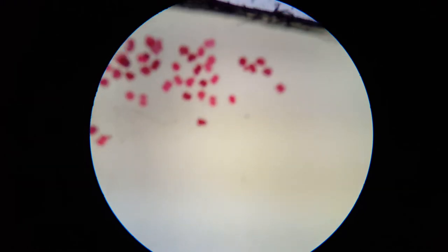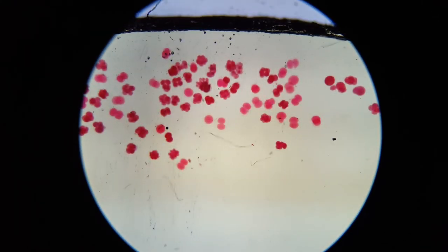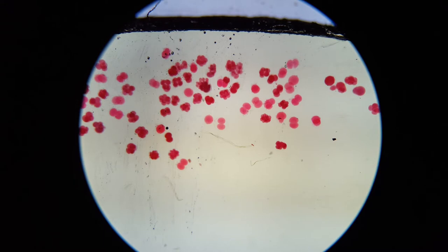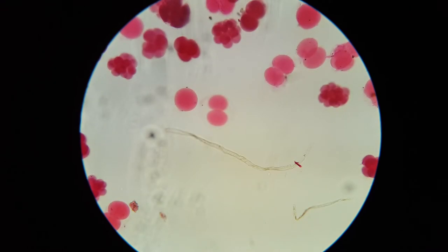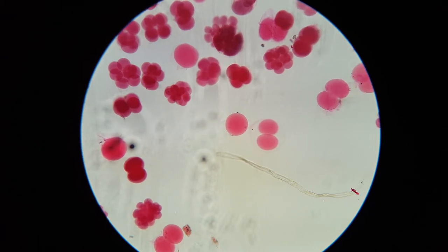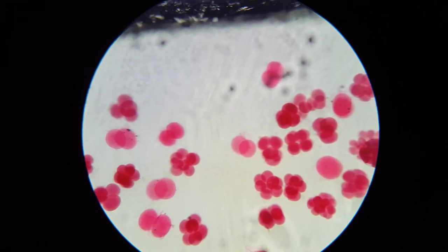Here are a series of slides on starfish development. The first slide is called Starfish Early Cleavage. I've got the mechanical stage as high as it'll go. I'm using the coarse adjustment knob to bring it into focus. Switching from the 4x objective to the 10x objective, you can see we've got either an unfertilized egg or a zygote that hasn't divided yet. We have the two-cell stage and then a bunch of other stages.